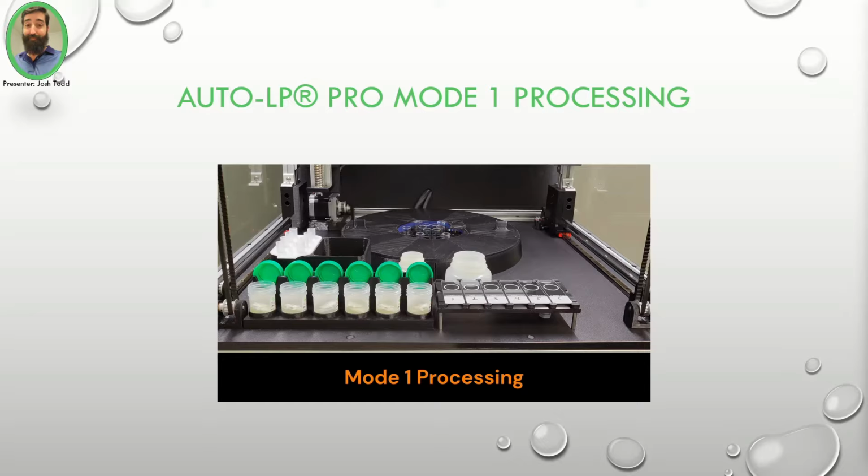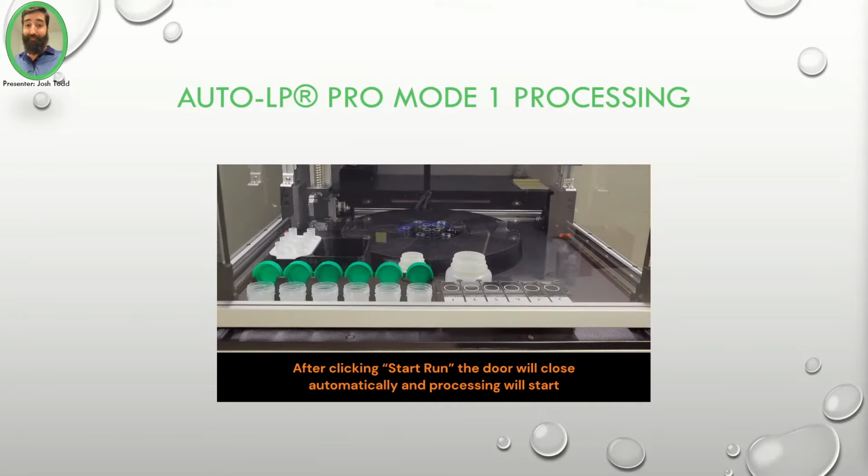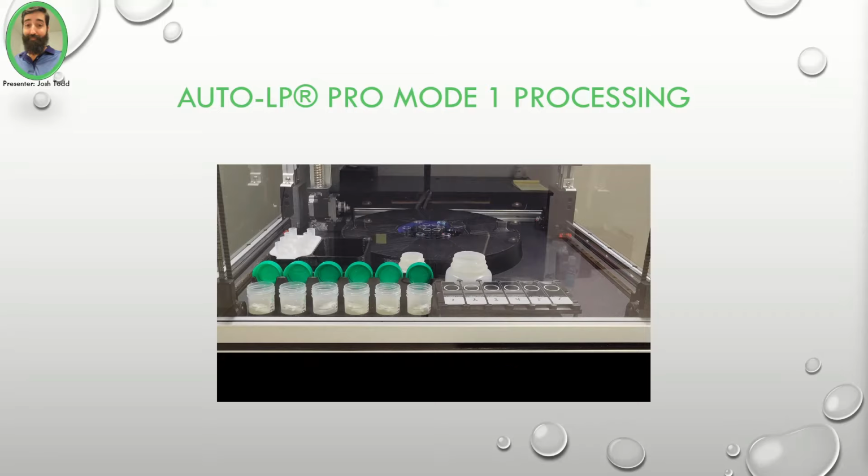AutoLP Pro Mode 1 Processing. I would now like to take you through a Mode 1 processing with 6 specimens on the AutoLP Pro. After clicking the Start Run button on the AutoLP Pro main menu, the door will close and your processing run will begin.